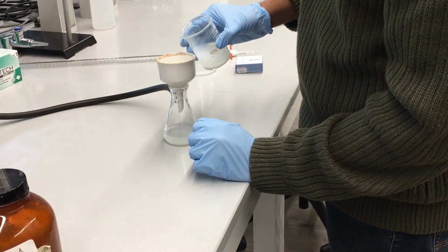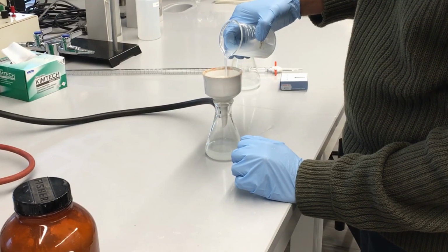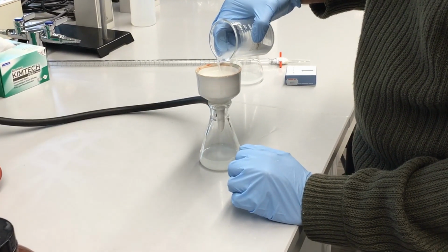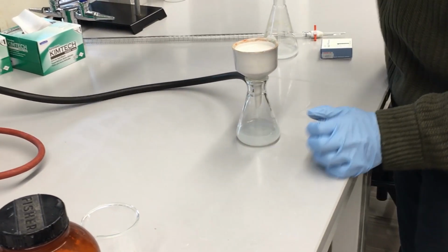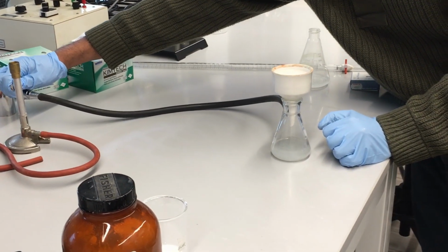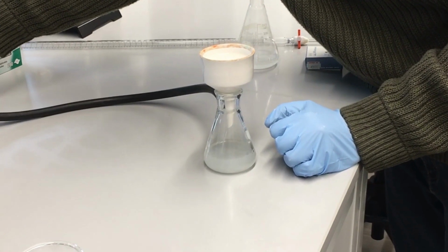And we can add the rest of our calcium hydroxide solution, as you see here, pouring it on top of our filter paper. We want to make sure not to get any solid into that filter. If possible, I want to leave all the solid behind. Now we'll turn on the vacuum once again, and that will pull all of the liquid, the aqueous calcium hydroxide ions, back through the filter paper, back through the filter, as you see here.